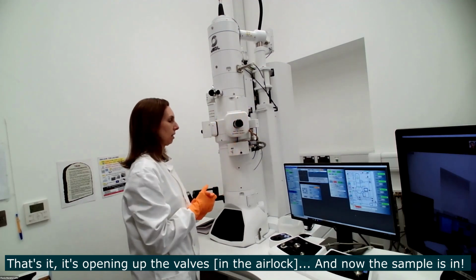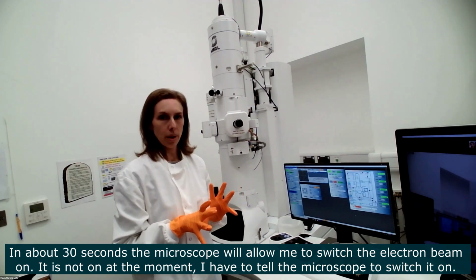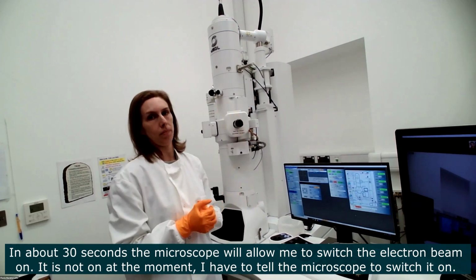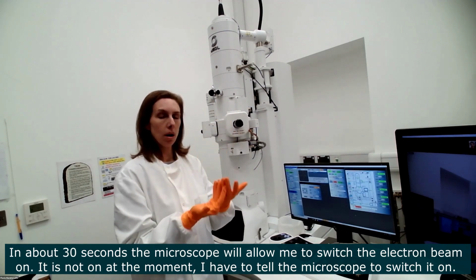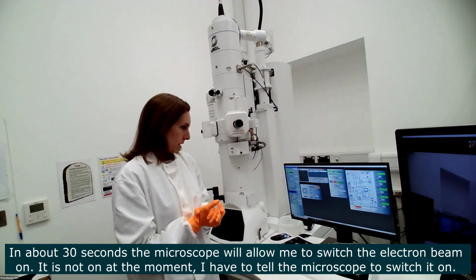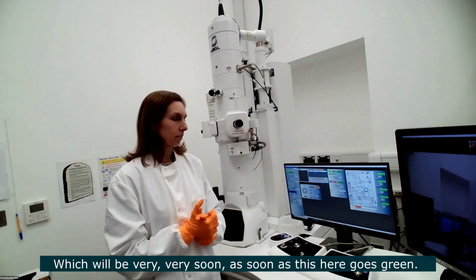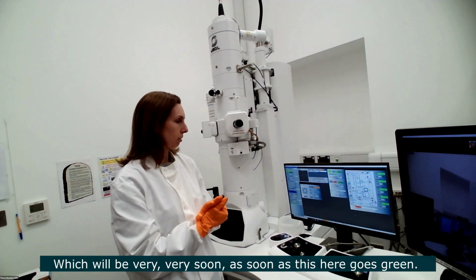Okay. The sample is in. And in about 30 seconds, the microscope will allow me to switch the electron beam on. The electron beam is not on at the moment. It will come on when I tell the microscope to switch it on, which will be very soon, as this goes green and it means it's all ready for us to image.